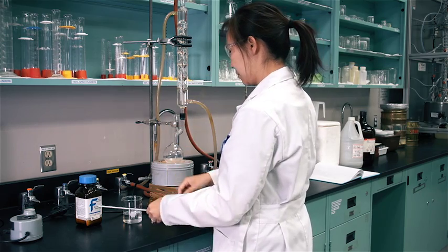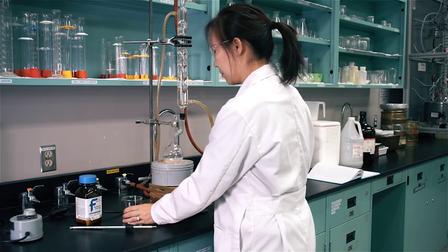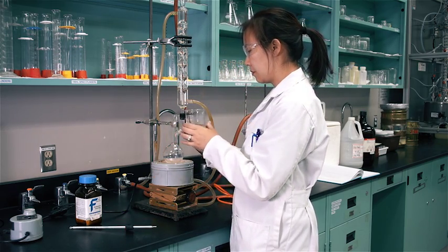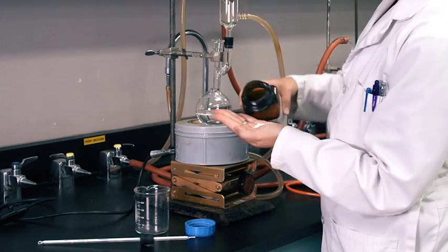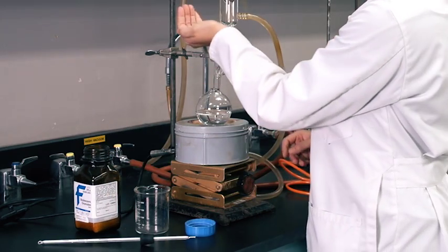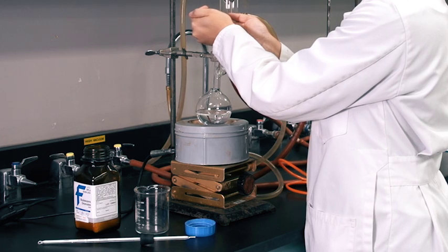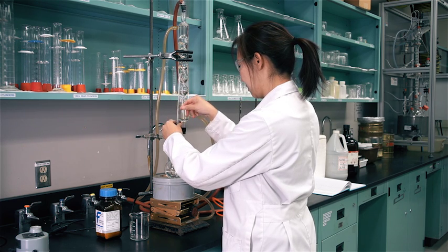Remove the thermometer and stopper from the flask and fill it to slightly more than one-third full with the liquid under investigation. Remember to add boiling chips. Restopper the flask.